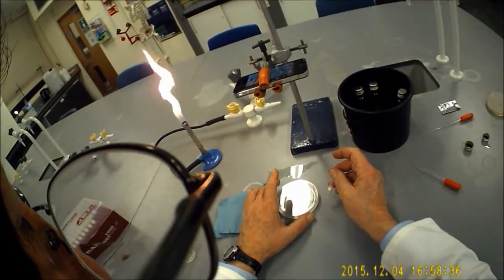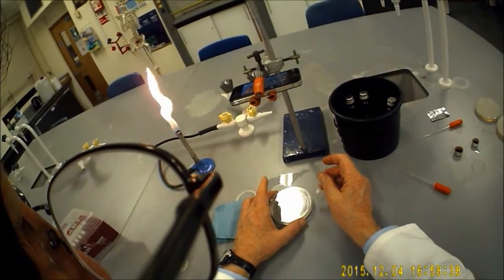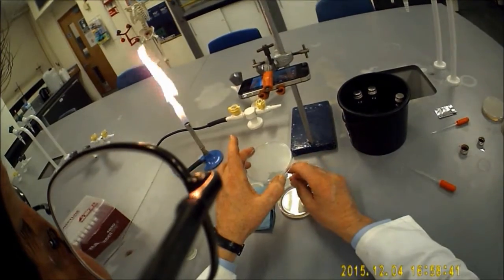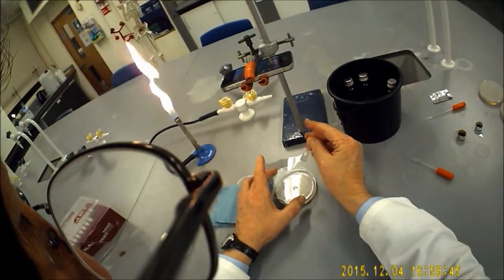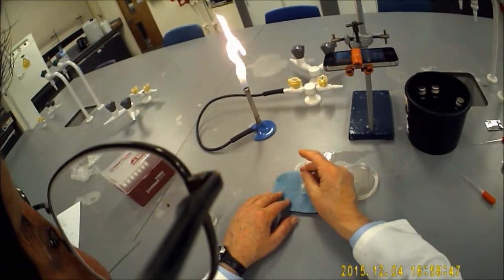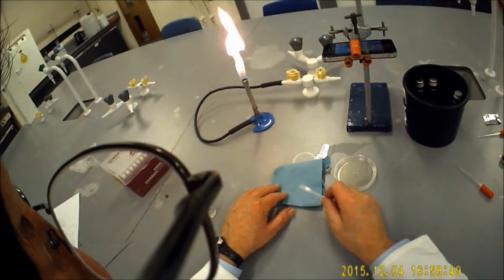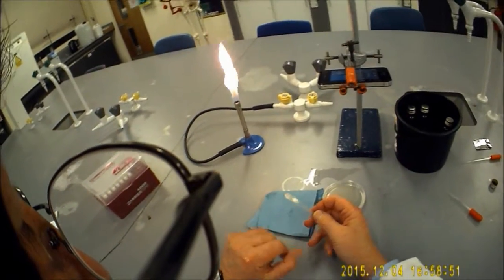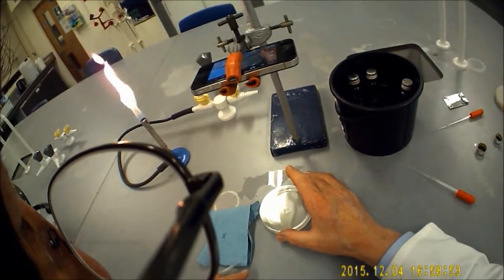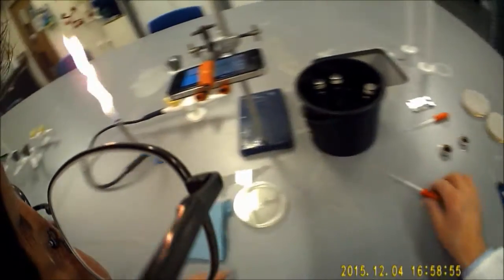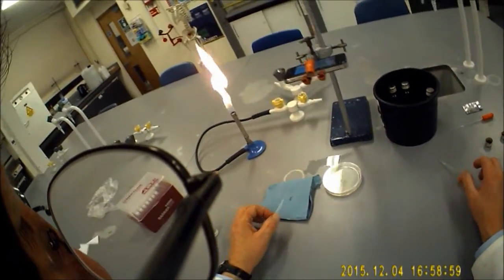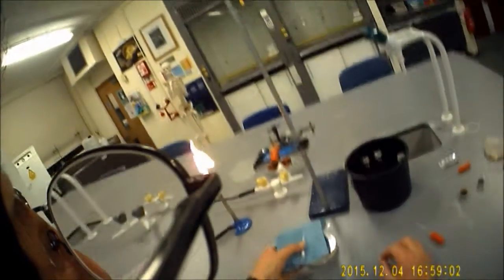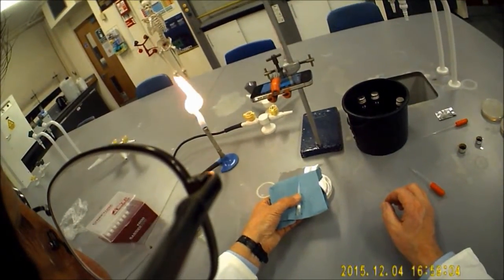So we're going to lift it up. You'll have to lift it up high enough to get underneath. And there's our little core just there. There is actually a core of agar in there. You can see just there that it's taken a nice clean core out of the pour plate. All of this is going to go into the autoclave.